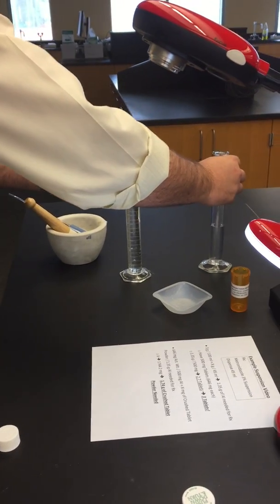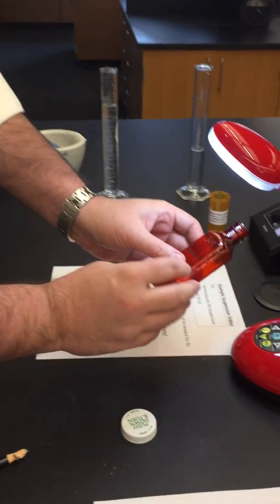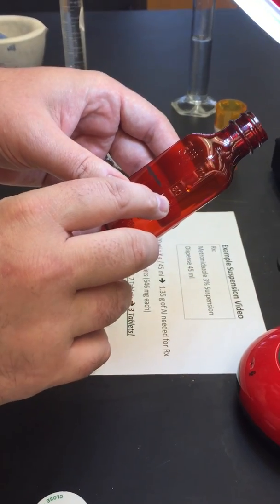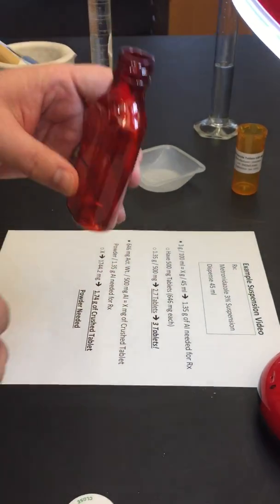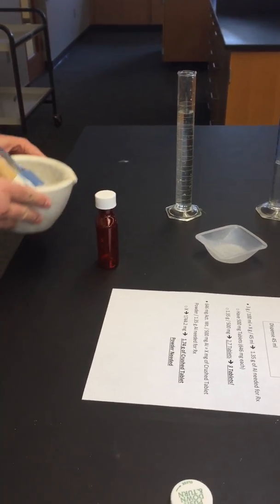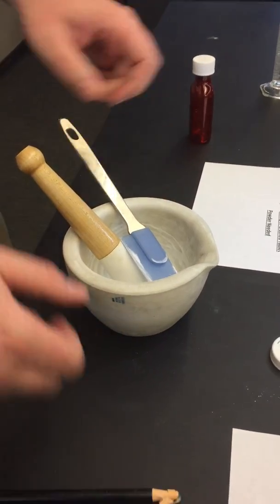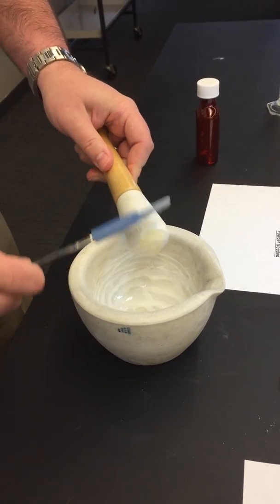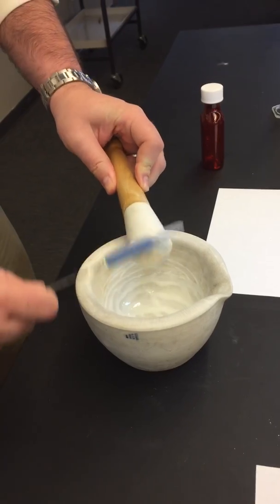Once you're done with that, you can toss this down the sink, and you have now calibrated your 2-ounce amber vial. And as you can see, there's some slight variation that's almost towards 50 as compared to the 45 mLs that we had measured out. So once we have our slurry, we'll come back to this guy. We'll try to get as much as possible off our pestle.